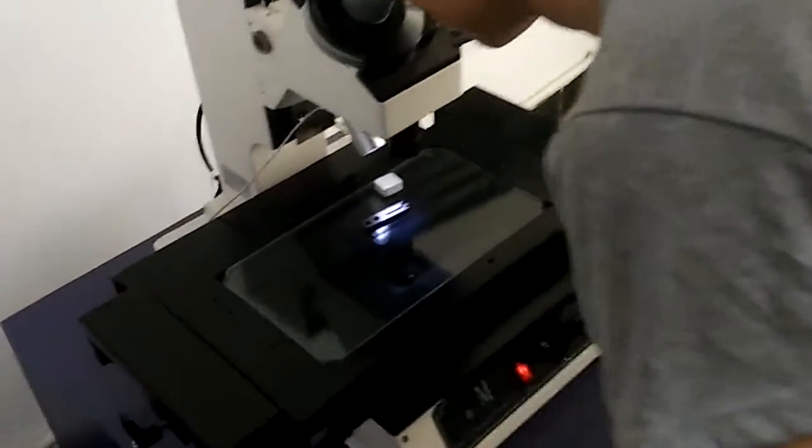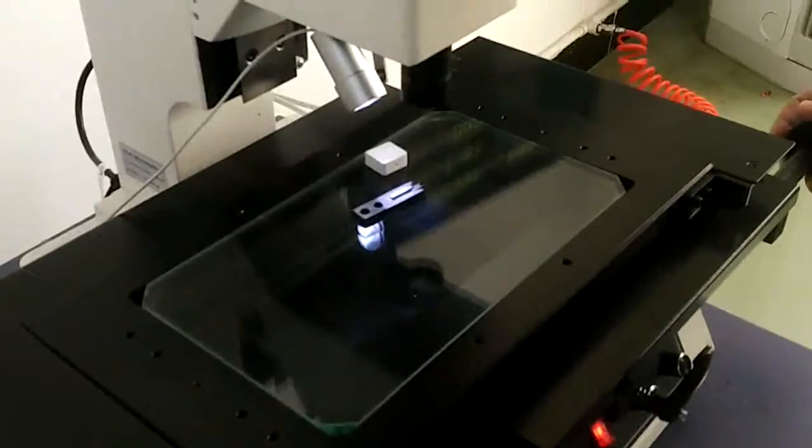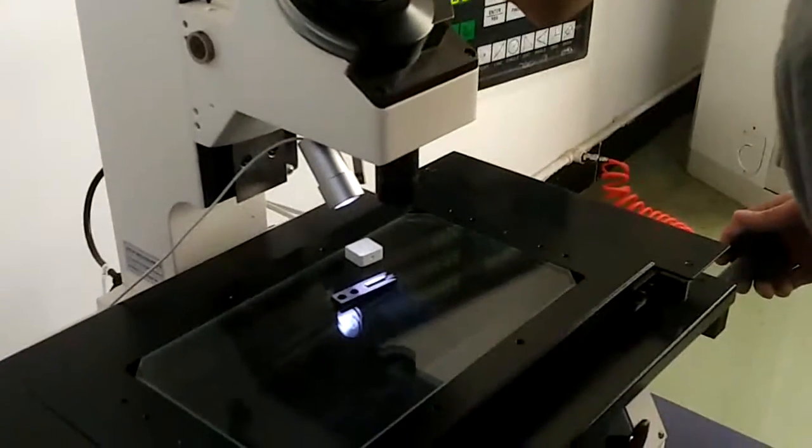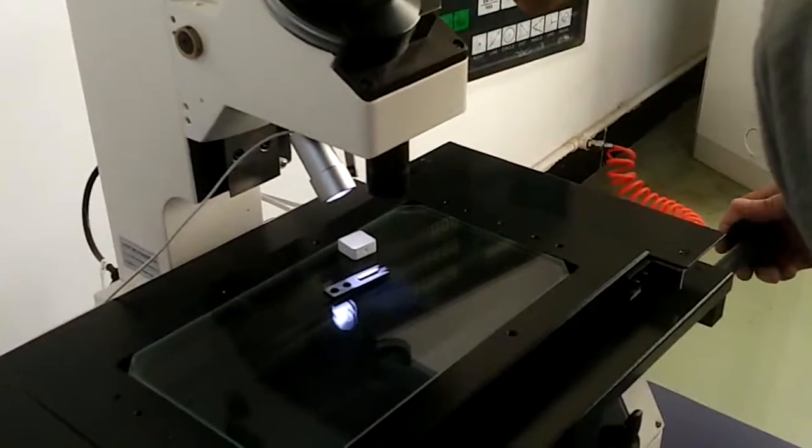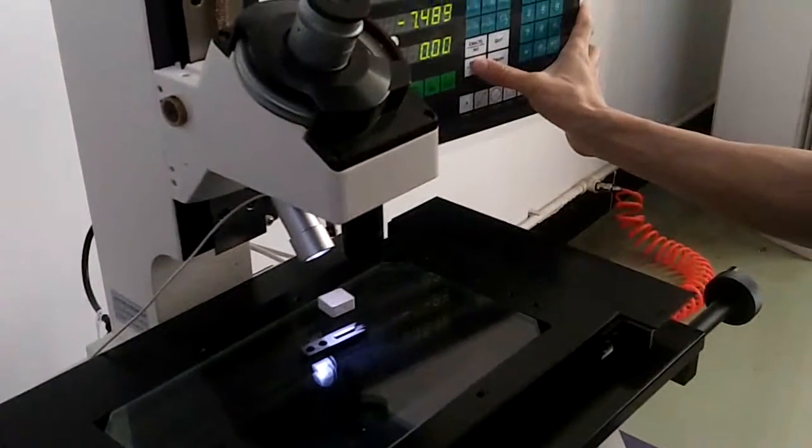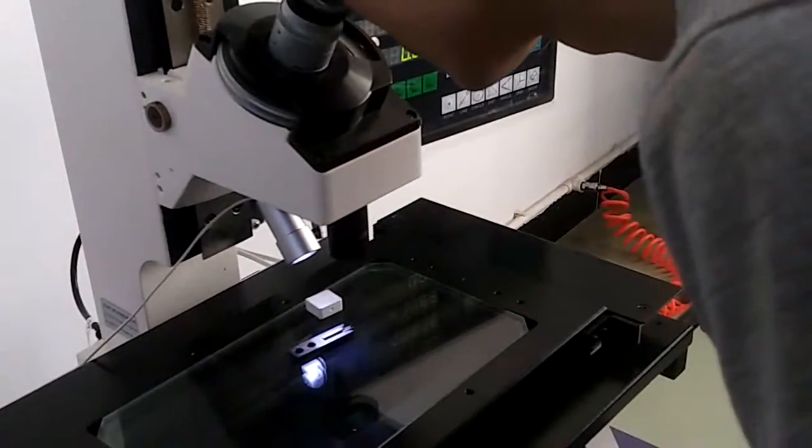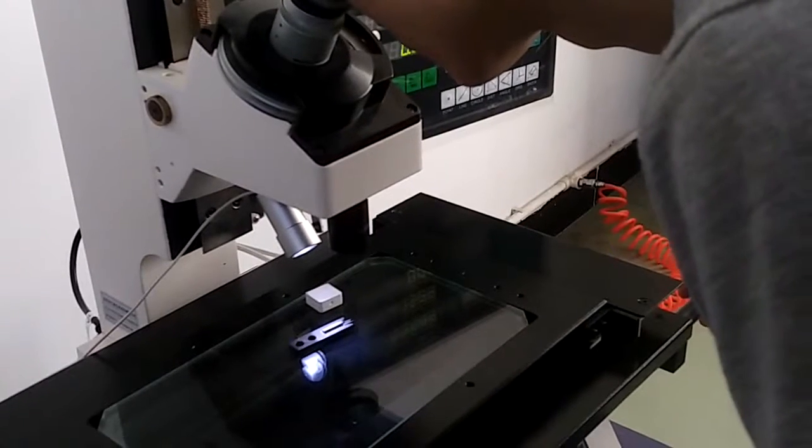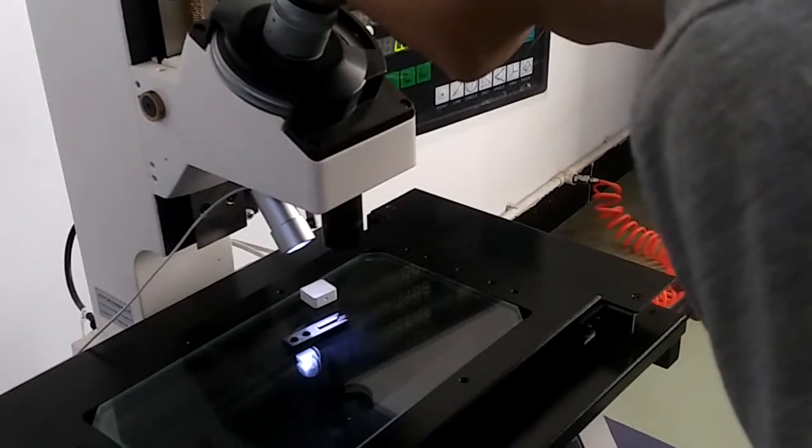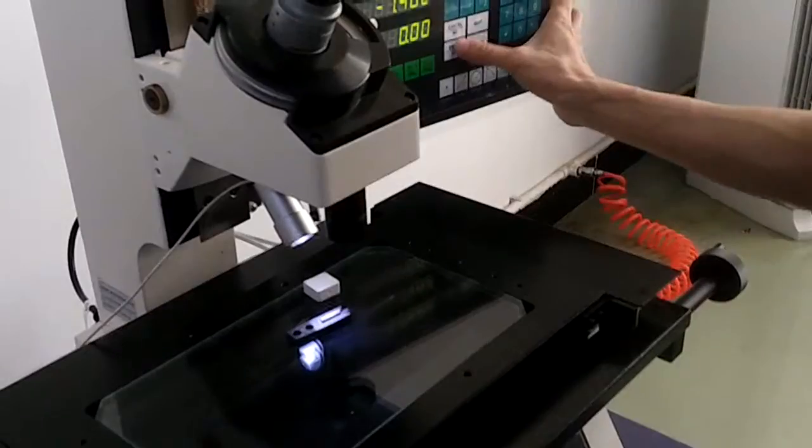Let's go closer to see it. Now, we have captured 2 points and after 1 point capture, this circle can be measured out.